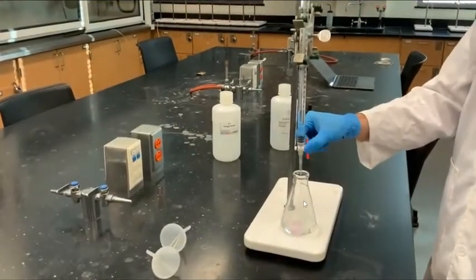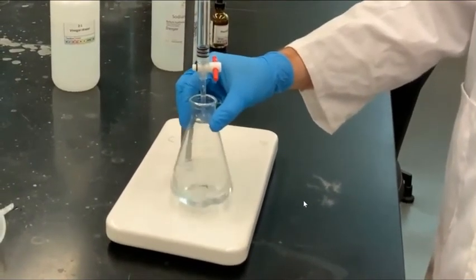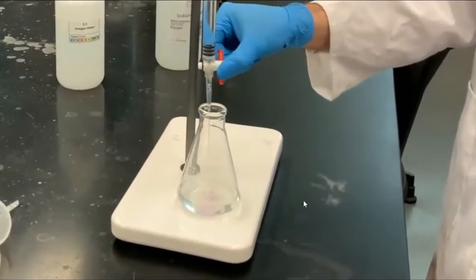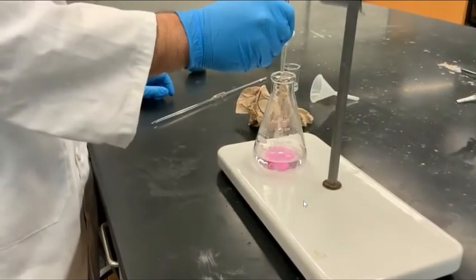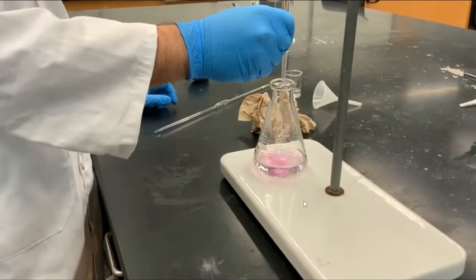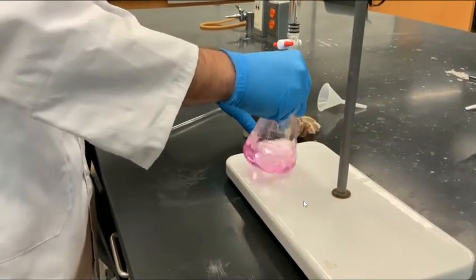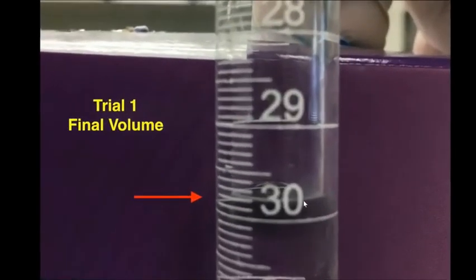We start titrating by adding the sodium hydroxide into the Erlenmeyer flask. You can see how the solution turns pink when the sodium hydroxide is added, but then disappears as it is mixed. Our goal is to titrate until the solution is light pink, which corresponds to the equivalence point. We can tell that we are approaching the equivalence point when the pink color takes longer to disappear when we swirl the flask. Here we are nearing the equivalence point, and with 1 more drop of sodium hydroxide, the solution turns pink. We now record the final volume of the sodium hydroxide for trial 1.